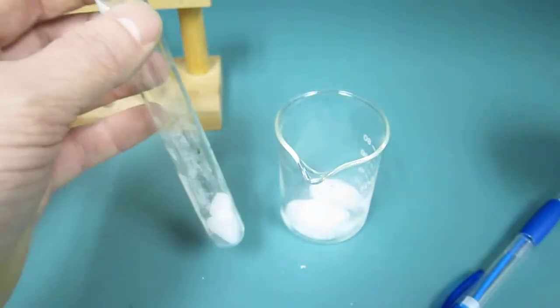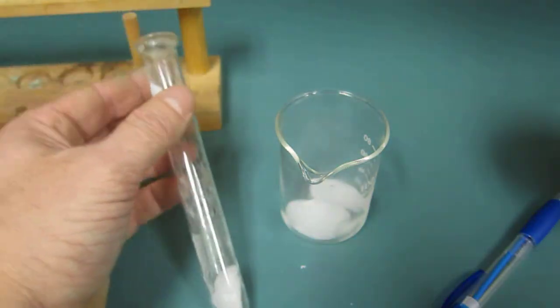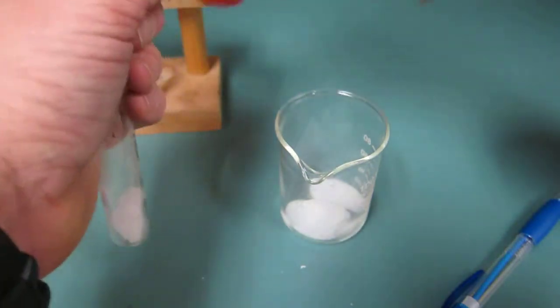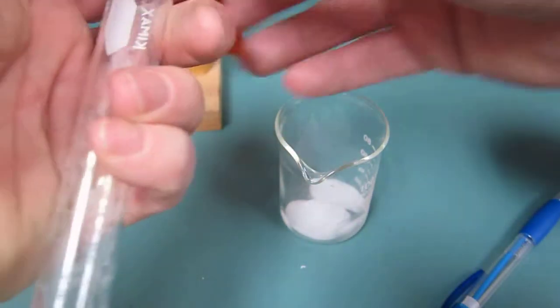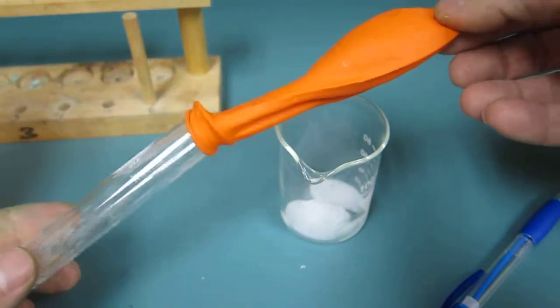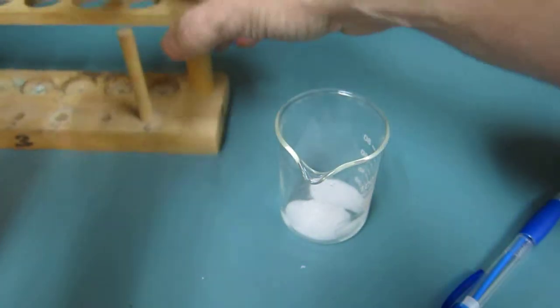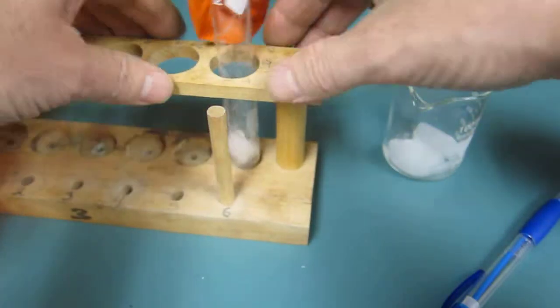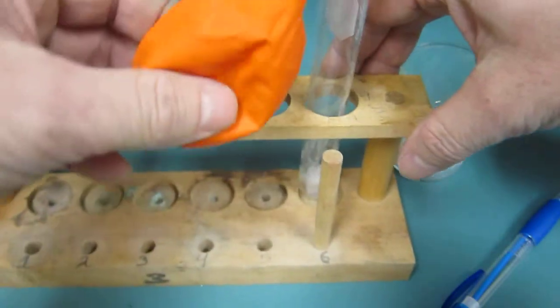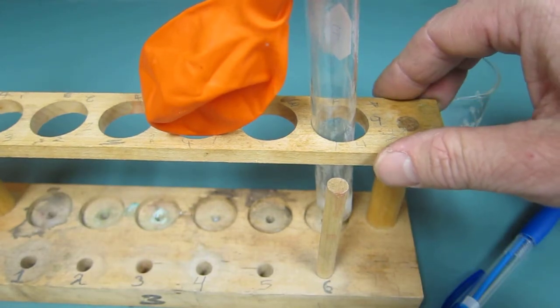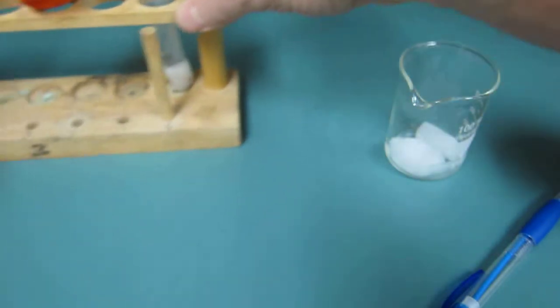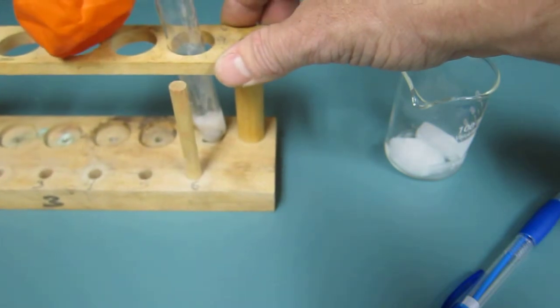And put a balloon over it like the directions say. That's going to take a while to get your observations for that. So look at the balloon now, and I'm going to just put that in here. We'll be able to take a look at that in a few minutes again to see what happens. I'll set that off to the side for now.